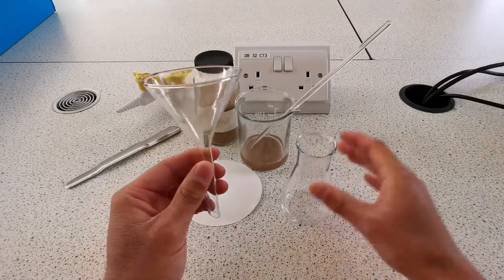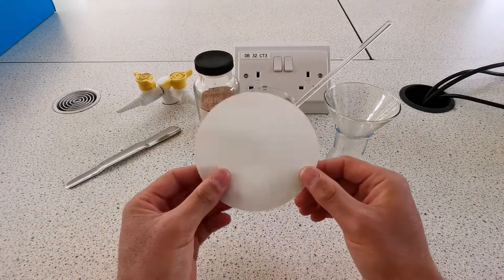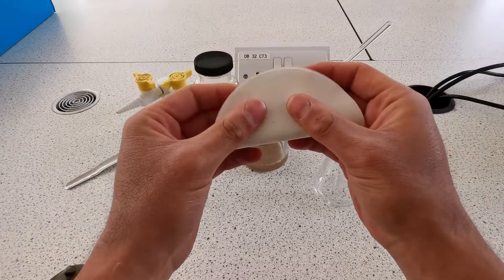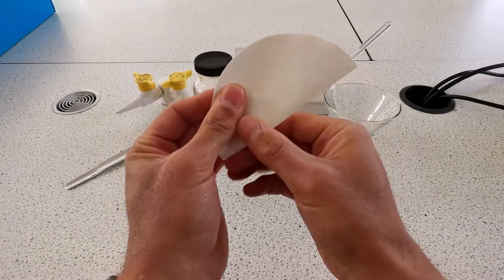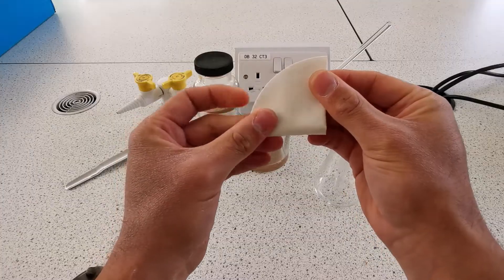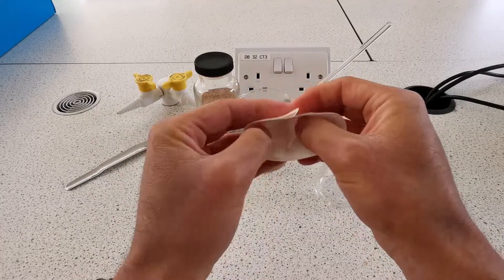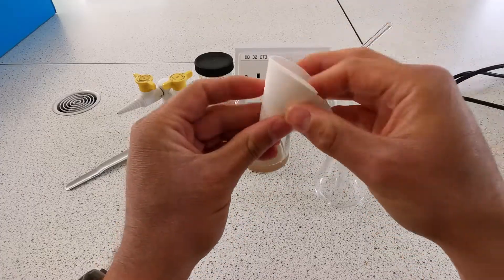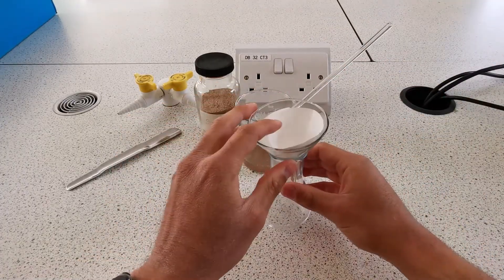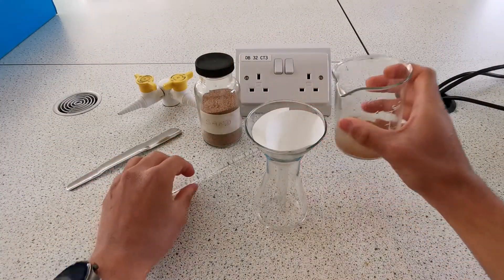What else we're going to need is the filter funnel and the conical flask. The filter funnel fits nicely into the conical flask, and we need to turn the filter paper into a cone. You do this by folding it in half once, folding it in half twice, and then opening it up. This will fit into the filter funnel. Then you want to pour your mixture into the filter paper.